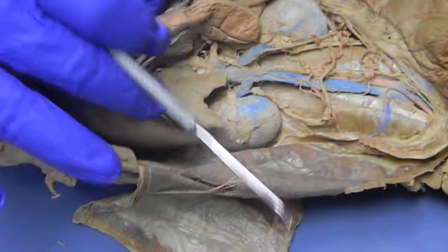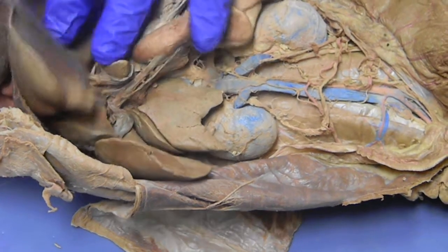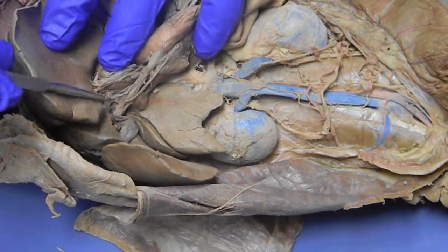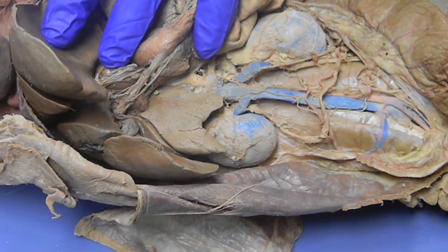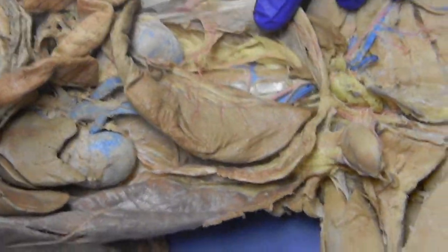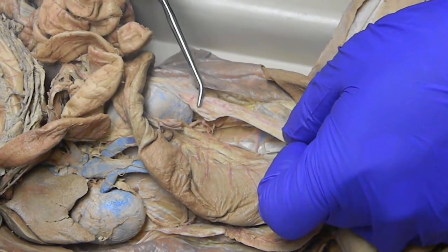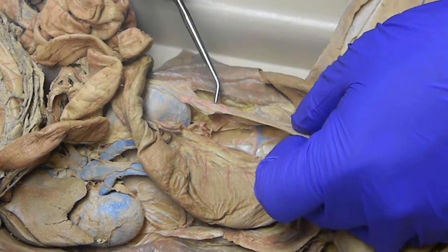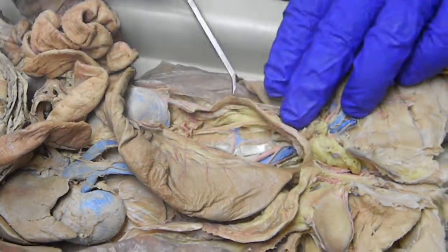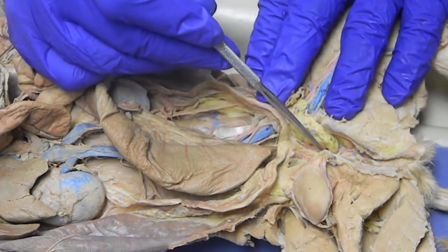Coming off the gallbladder, which is right there, we have the common bile duct. The common bile duct bifurcates right here to form the cystic duct, which goes over the gallbladder, and the hepatic ducts, which go back into the liver itself. This is a female, immature. The ovary is this little bean-like object right there. On the other side, you see a little tiny tube that circles around — that's the oviduct. Where it has a little fringe right here at the opening is the fimbria. And then this large tube going down on both sides is part of the uterus — these are the uterine horns. And we have the body of the uterus. This enlargement right here is the cervix.